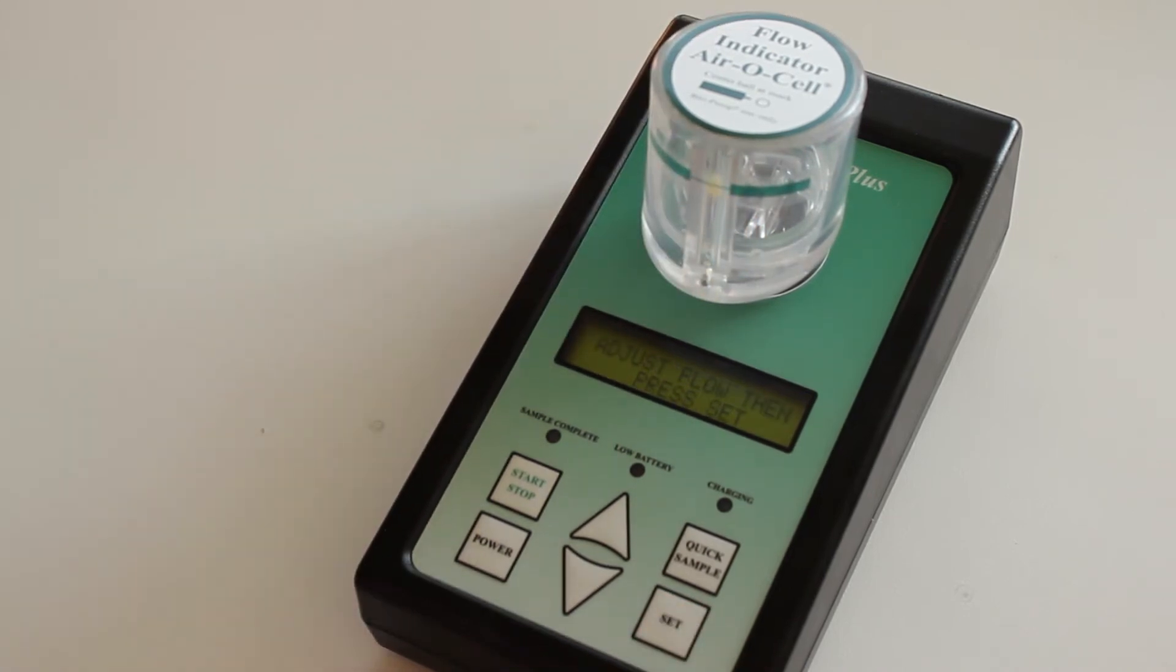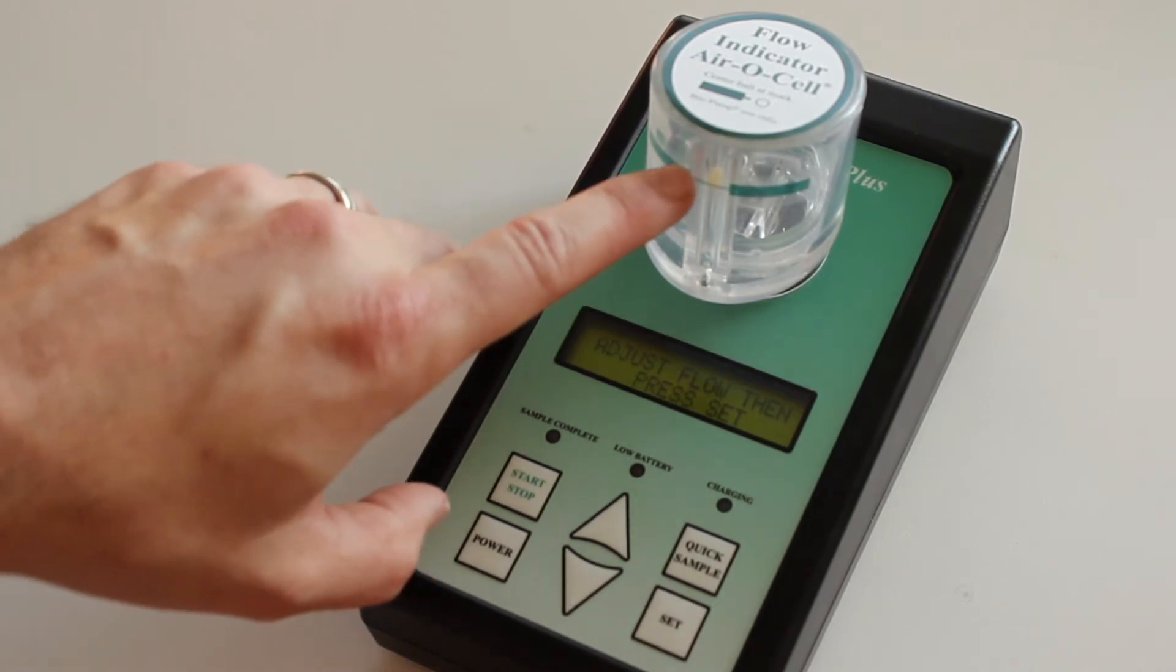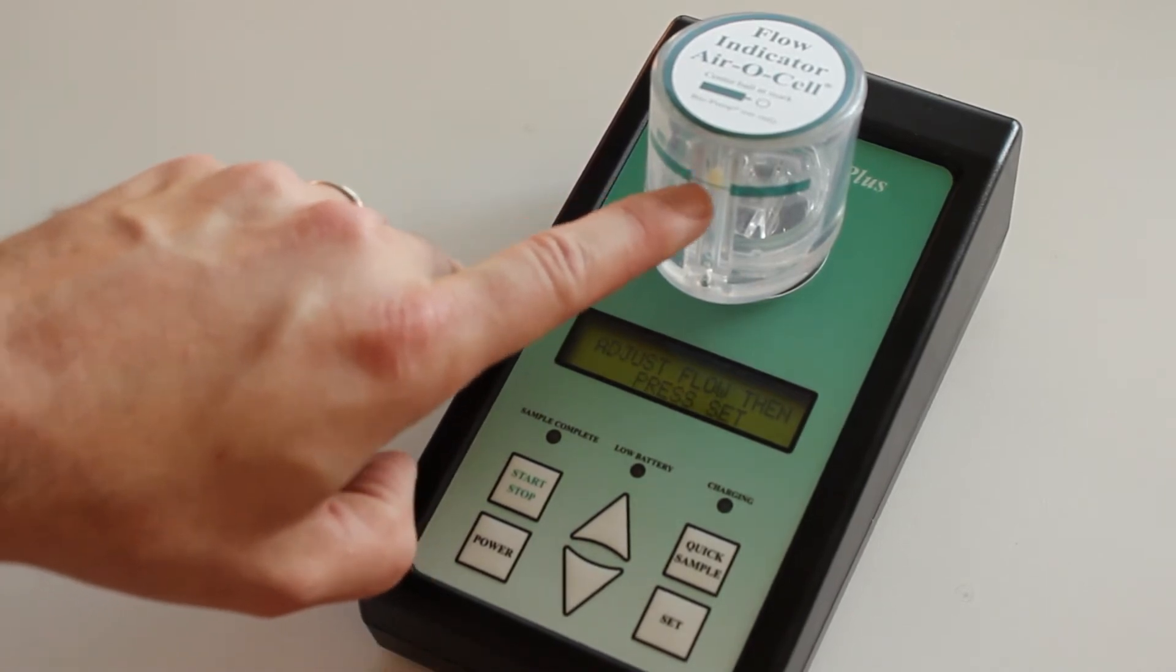It will start up pretty quickly, quicker than normal, and what you're looking for is this ball to remain in the center of the line here.